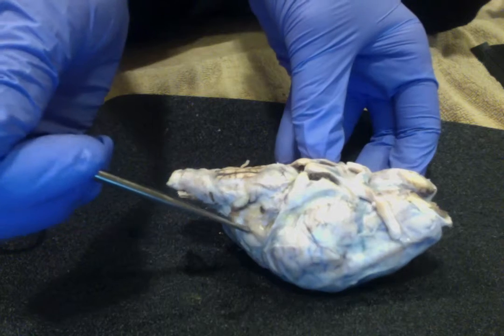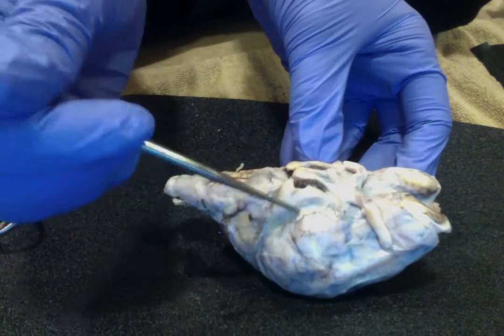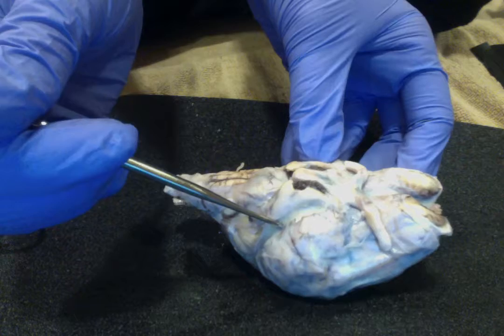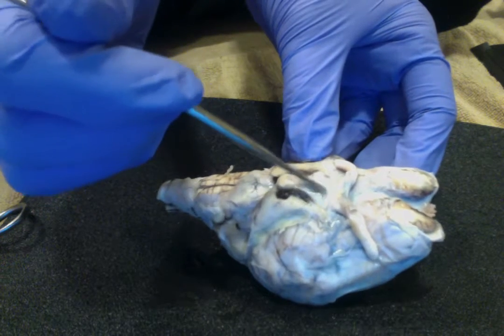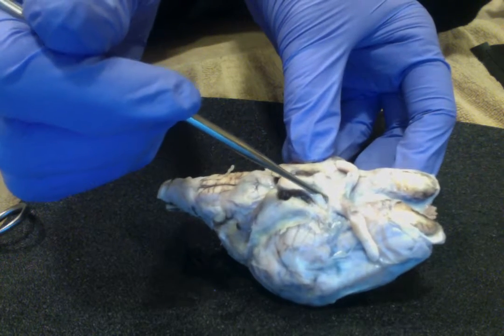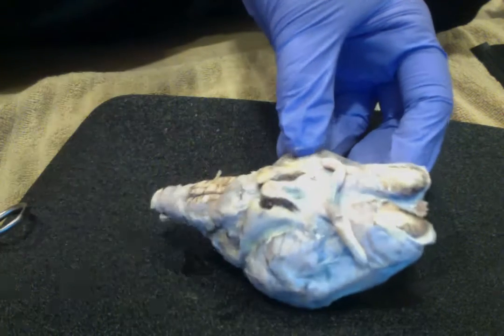Cerebrum. Parietal lobe. Optic chiasma, right in here. Mammillary body is going to be right in here.